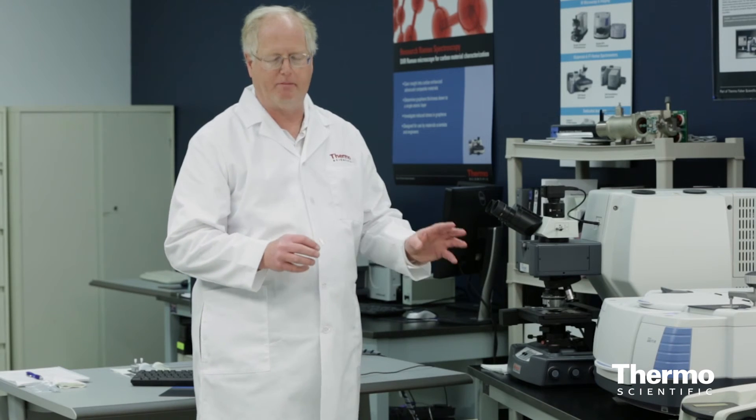So for solid phase KBr pellet style spectroscopy, that's all you need to do when you get to the instrument. Place the pellet into the beam, run the experiment with the background of the KBr, and you're good. And that's it for the transmission of solid phase spectroscopy.